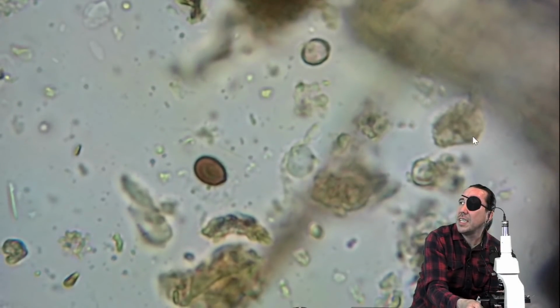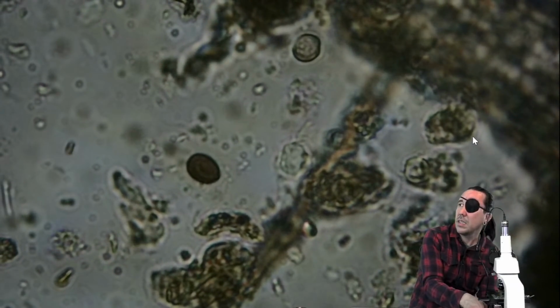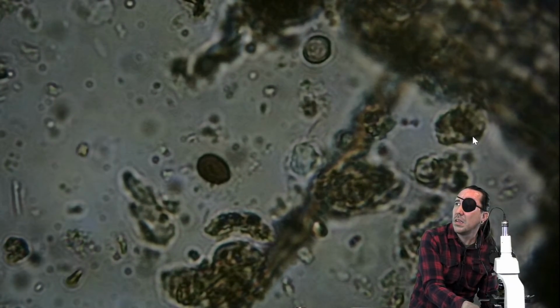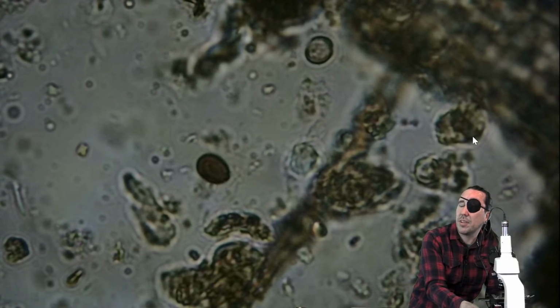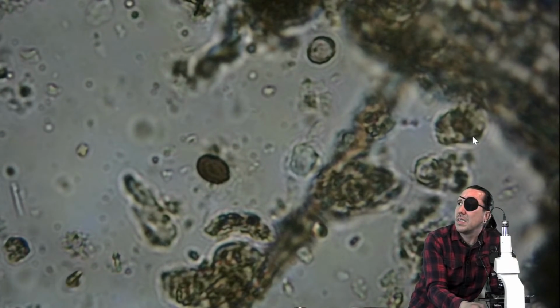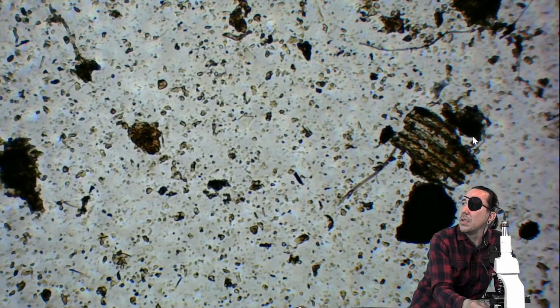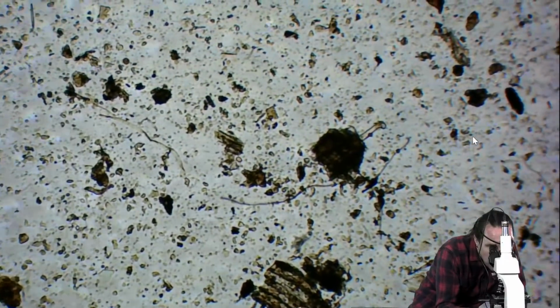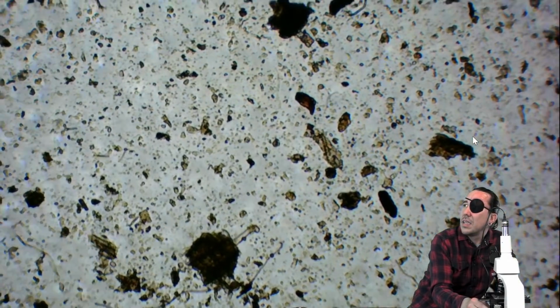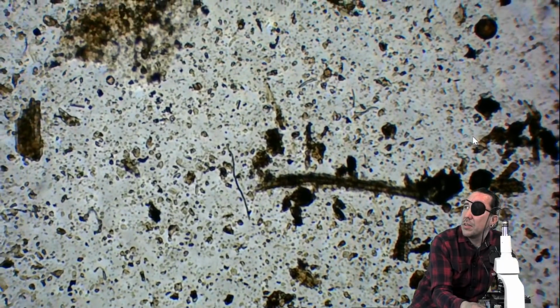So I'm going to shadow real quick and we'll see if maybe there are some ciliates. I'm going to make it a little bit darker here. Yeah, I'm not seeing any movement. I'm sorry, I said ciliates, I meant to say flagellates. I don't mean to confuse you. All right, I'm going to go back out to my 4x objective lens, or 40 times magnification. I'm going to move through all this more quickly to see if we do have any nematodes, and then we'll come back through it.